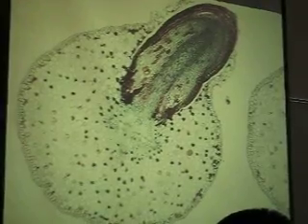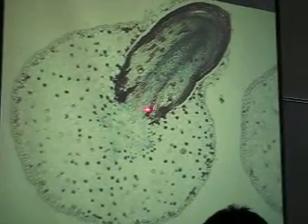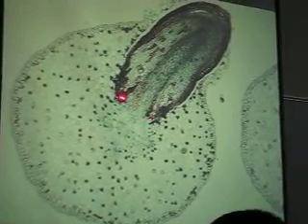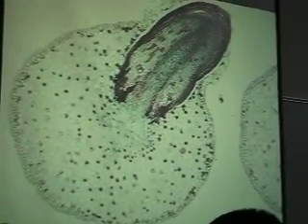Okay, now number 2 is in your textbook. This is the willow, and it shows the origin of a secondary root. See how it's connected to the vascular stele here? So there's the direct vascular connection. It erupts right through the cortex, pushes aside the epidermis, and we have direct vascular connection between this root and a secondary root.